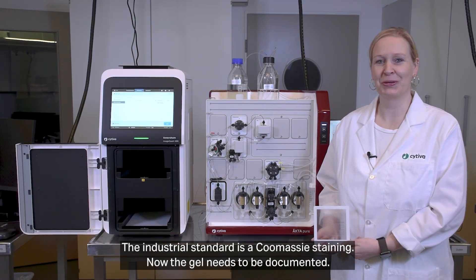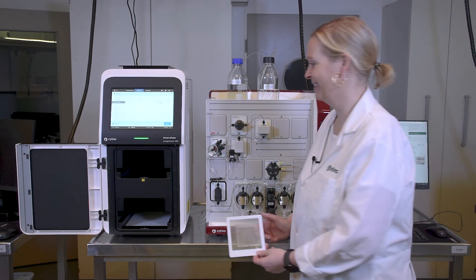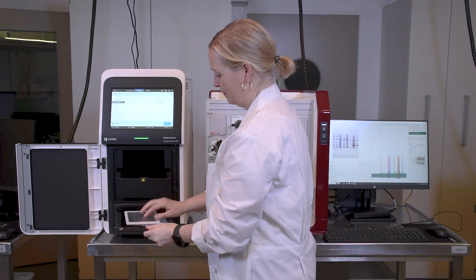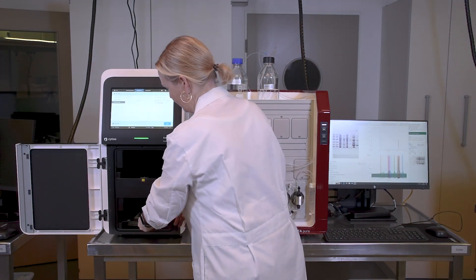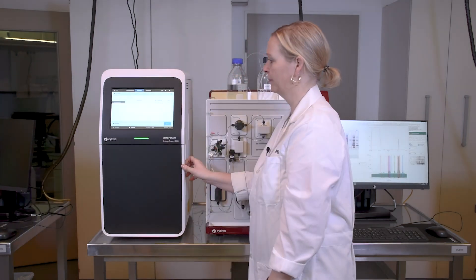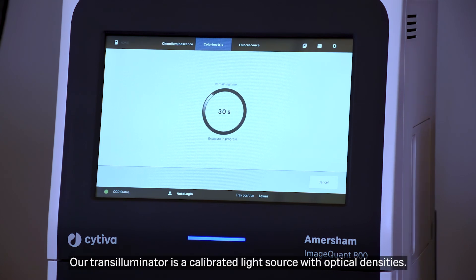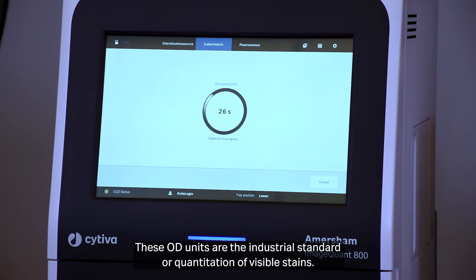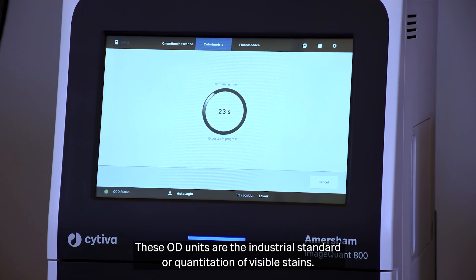Now the gel needs to be documented. I'm using the trans white light for visualization. Our transilluminator is a calibrated light source with optical densities. These OD units are the industrial standard for quantitation of visible stains.